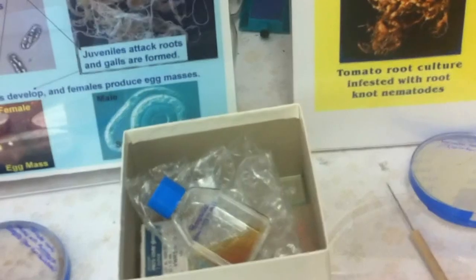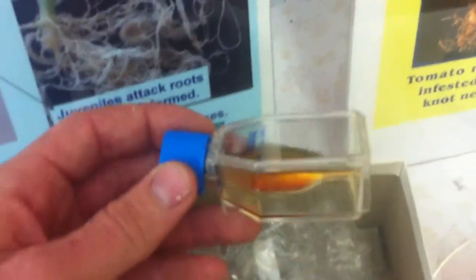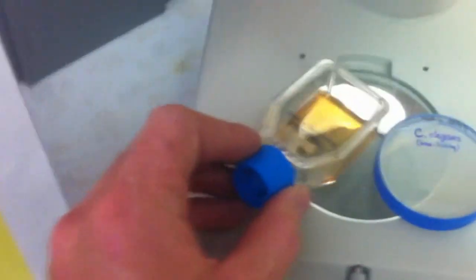And then the next thing I want to focus on is the nematodes themselves. We're going to have two different types of nematodes in culture. Here's a box full of goodies. Now it's really important that we respect the supplies here, because this is lent out from the nematology lab from USDA. Much appreciated from Carol and Susan over there, as well as Shannon. But this you can essentially just put right under the dissecting scope.